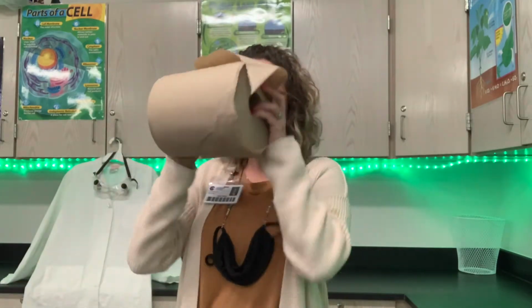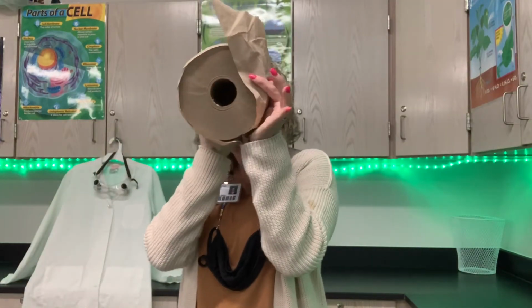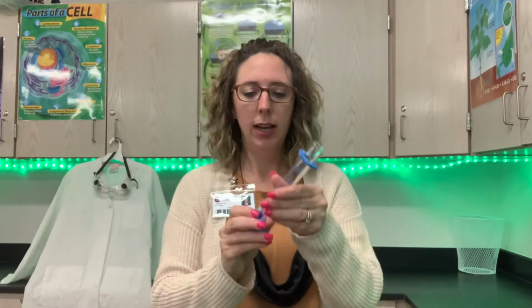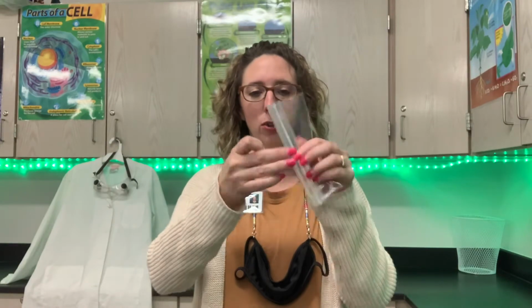I have my roll of paper towels. Hello, I see you. I have my baking soda, my vinegar, and a little scoopula to scoop up my baking soda, and I have a graduated cylinder, and a little plastic baggie. So what I'm gonna do is a few little tricks, or not really tricks, but I'm just gonna show you what are some physical changes and chemical changes. All right, so let's begin.